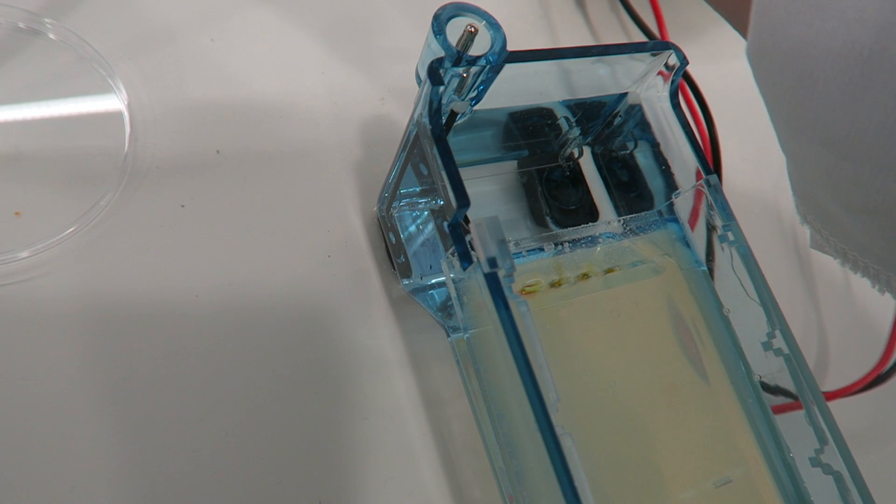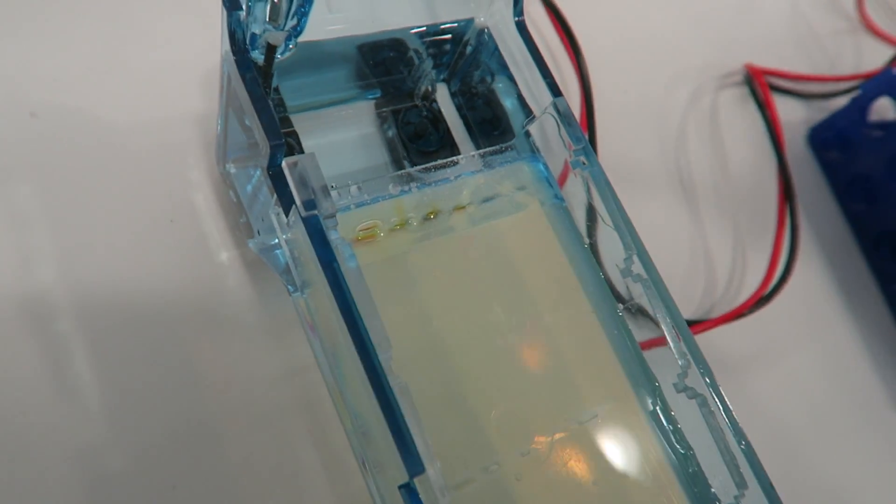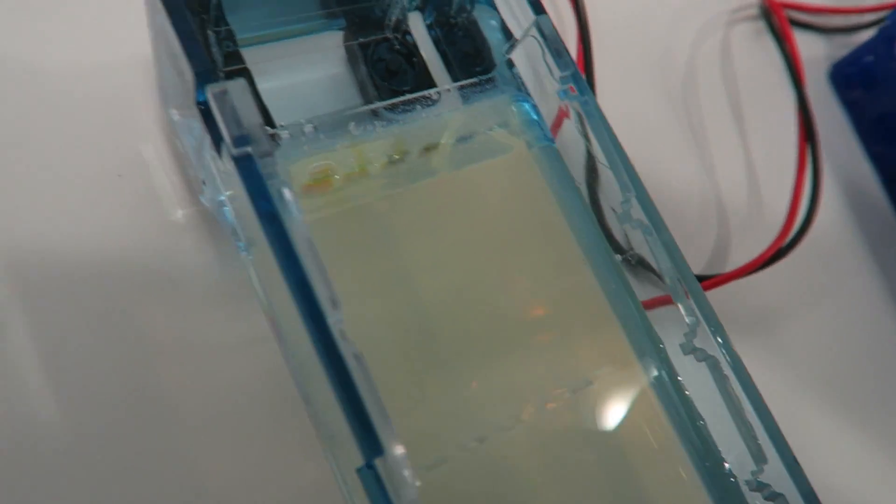This gel can now have the lid put on it and it can be turned on, the power moving the DNA sample through the gel.